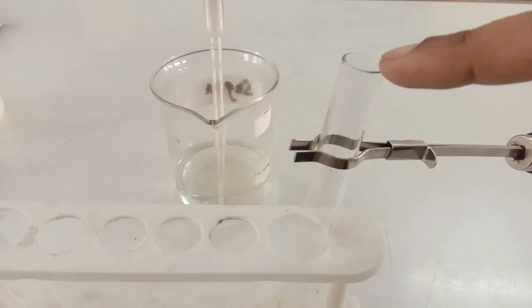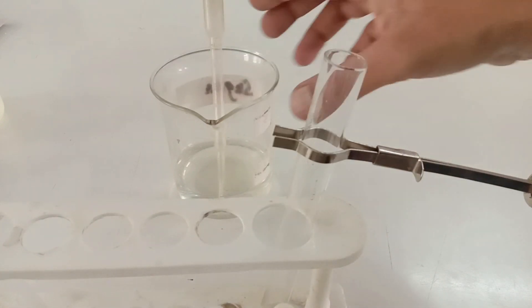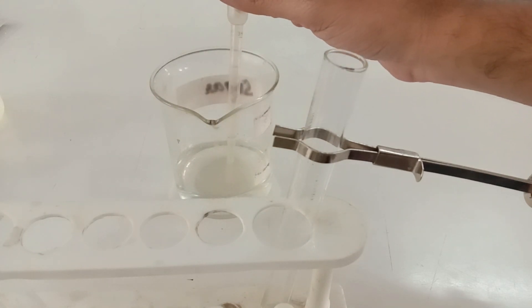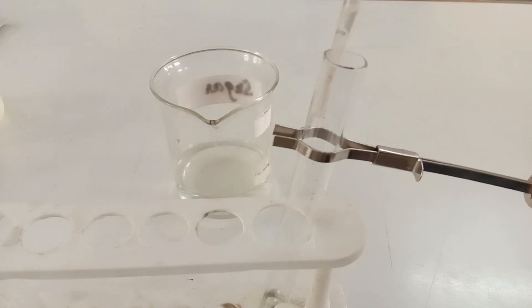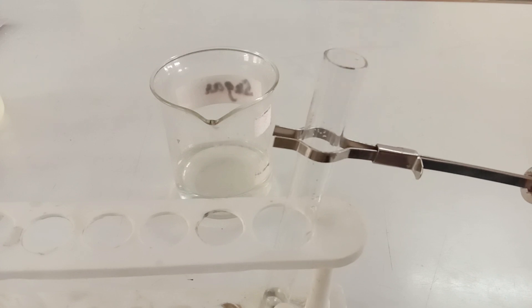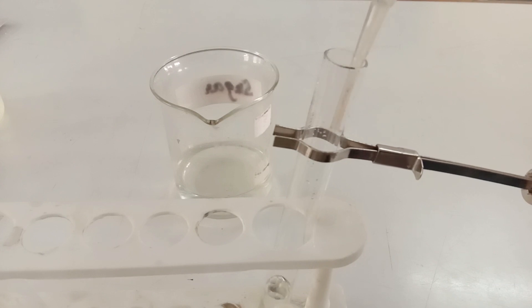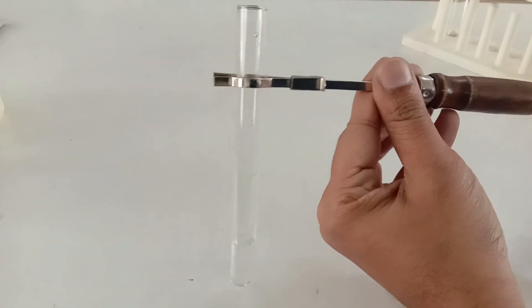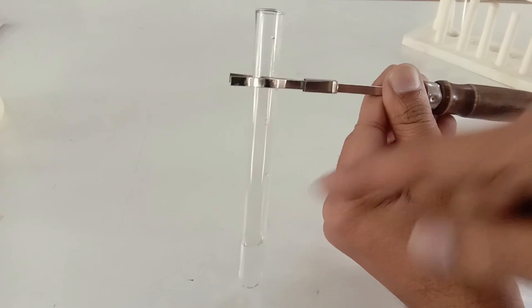Let's begin with the experiment. I have already attached a test tube with a test tube holder. Now I'm going to take about 2 to 3 ml of food solution with the help of a dropper and pour it into the empty test tube. This is the food sample in the form of a solution.